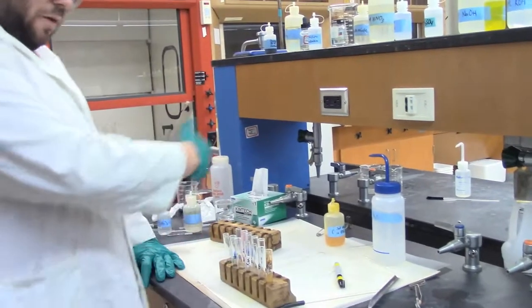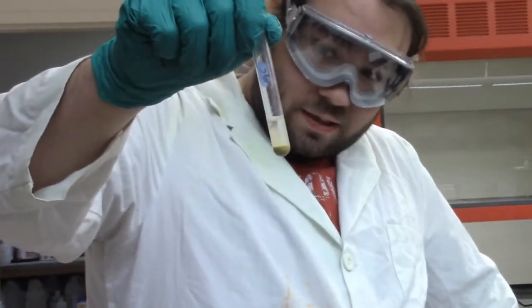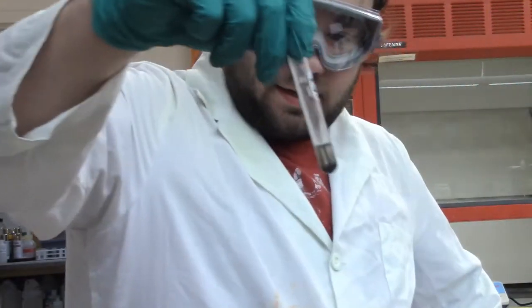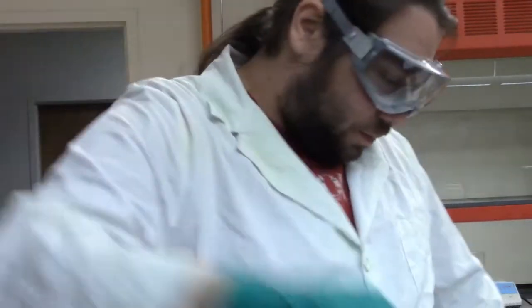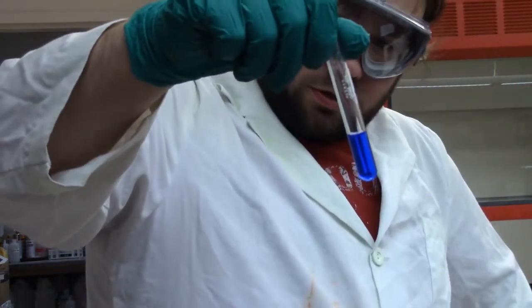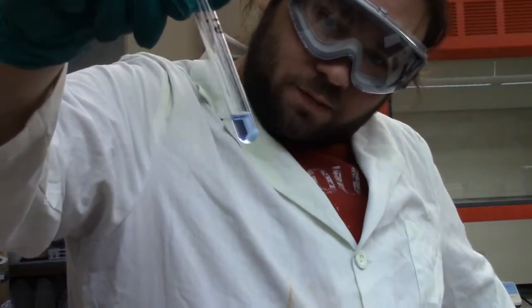Toxic Avenger. The Toxic Avenger. And we have all of these tests here. So to go through them quickly, here's what our tin looked like. We have a colorless solution, maybe slightly cloudy with a tan precipitate. Our cadmium is that stuff we made earlier that seems to have precipitated, so now we're mostly colorless, a dark solution with what looks like a black precipitate. Our copper gave us this deep blue solution, this royal blue. Our bismuth, we had that light blue solution with a white precipitate at the bottom.